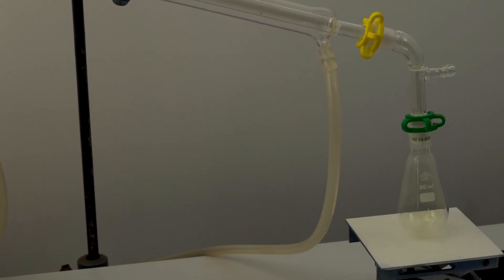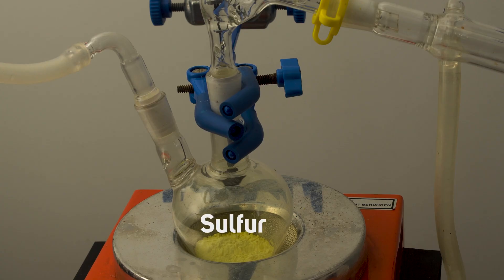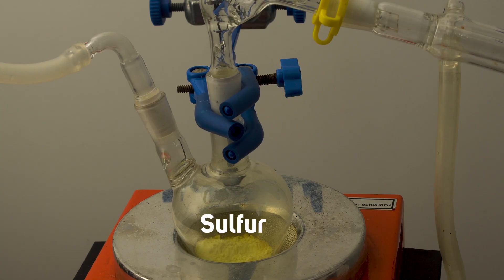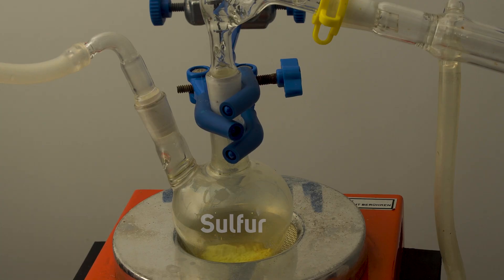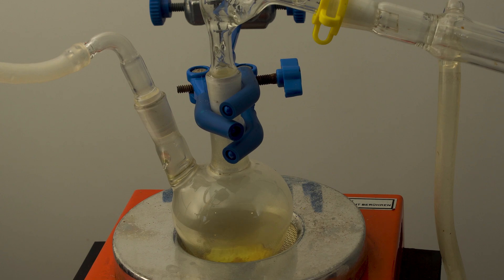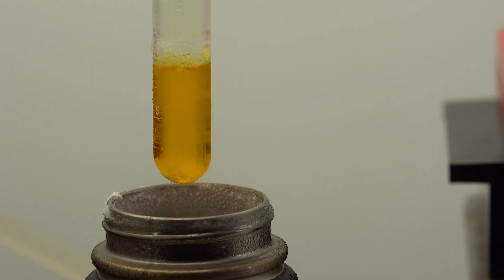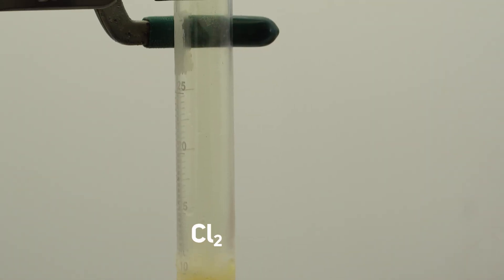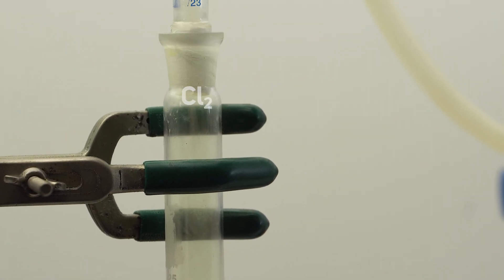I turn on the heating mantle, the sulfur begins to melt, and you can see how the inside of the flask is filled with sulfur vapor. Now I allow the chlorine to begin boiling and enter the flask with sulfur vapor.